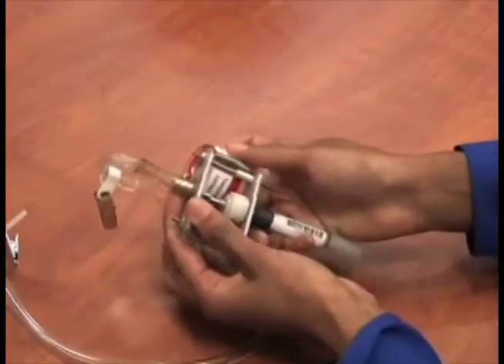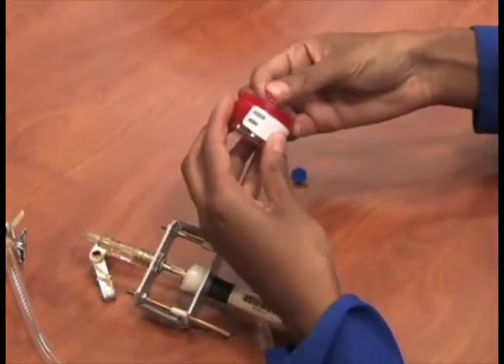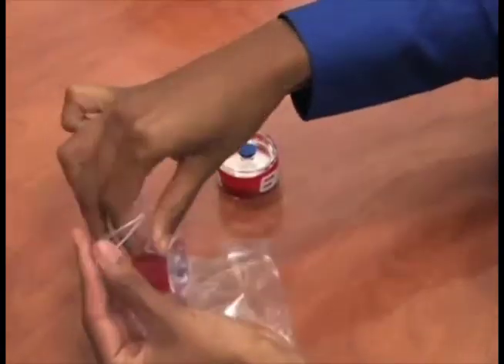After sampling, remove the cassette and reinstall the nibs, and wipe off any dust accumulated on the Cyclone prior to shipment back to the laboratory. Place the cassettes in the Ziploc bag for shipment to Galson Laboratories.